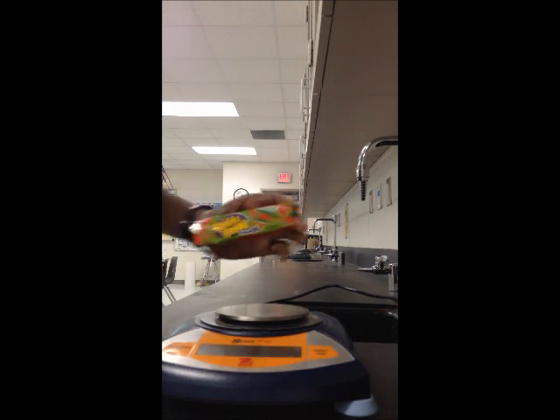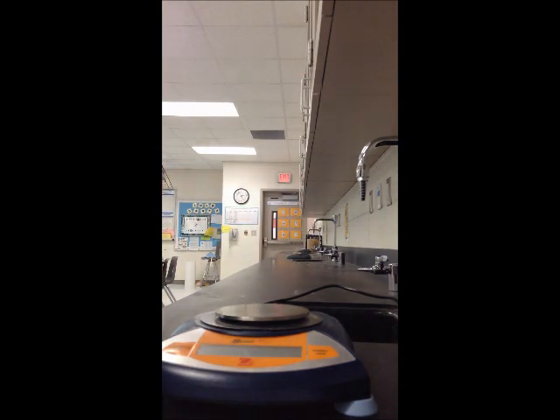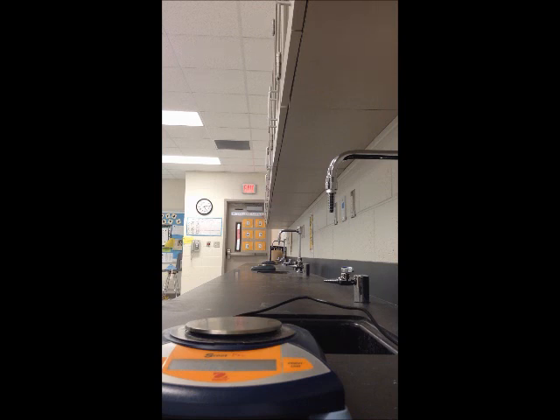So I'm going to start with Hubba Bubba Strawberry Watermelon Bubble Gum. So you will need to write that down on your paper. So I'm going to weigh the mass of the empty cup first, so we can fill in that on our data table. Before we do that, we need to tare the scale to 0. All right, now the cup. The mass that you're going to record is 2.351. Go ahead and add that all the way down on your table.